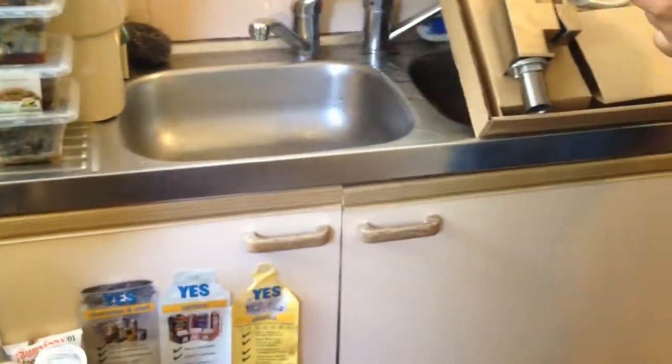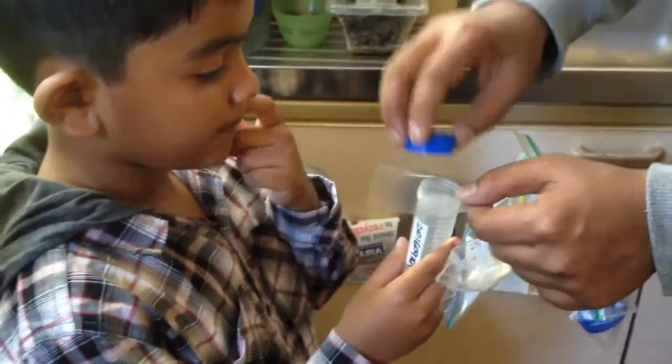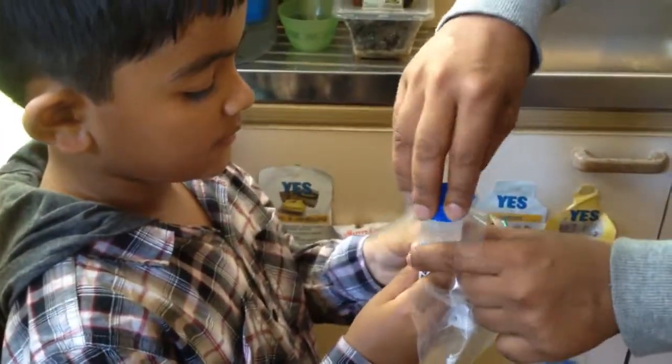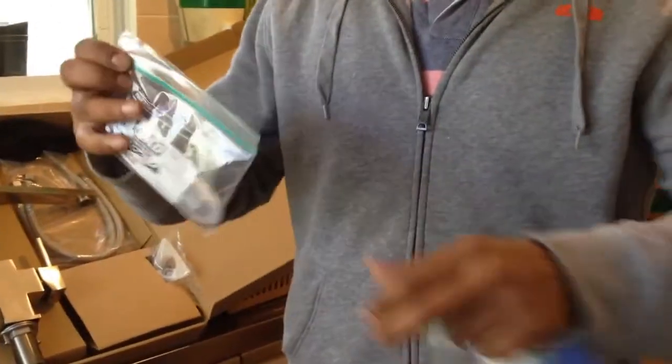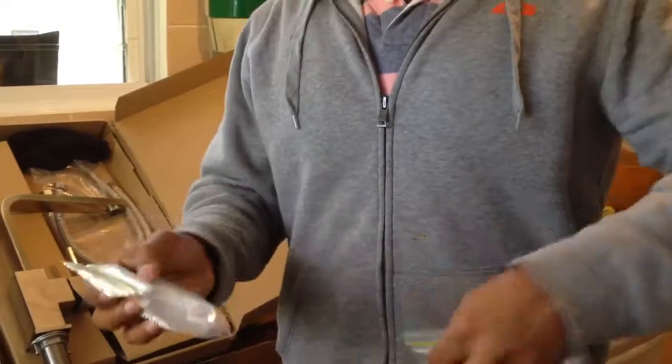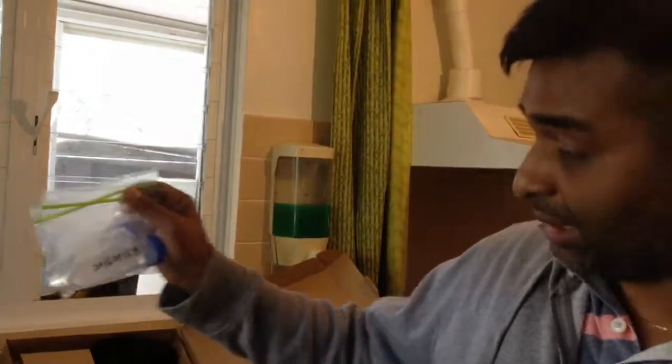Now that's number A. The same way I have just sealed it. The lid is a bit tight. So now we have seen the whole process — how I collected the water samples which we think is contaminated by lead.